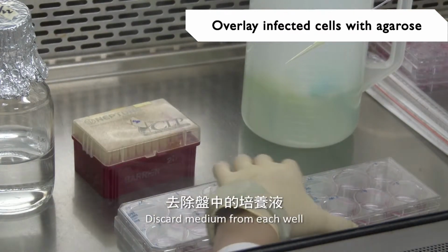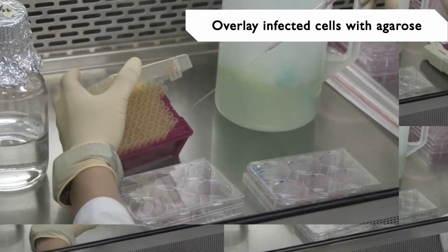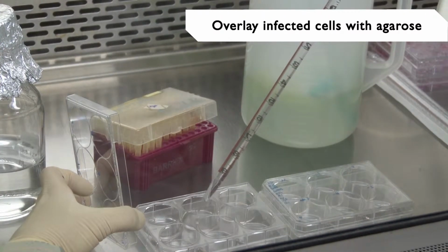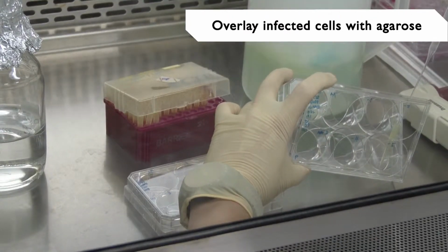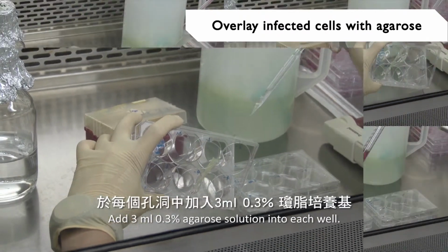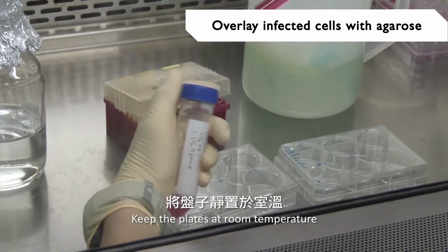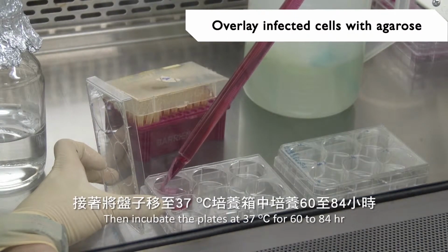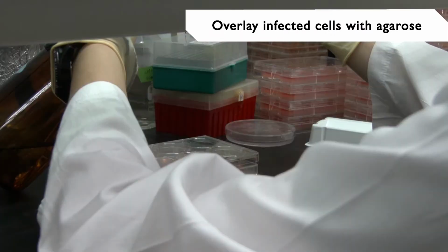Discard medium from each well and wash cells with 500 microliter PBS. Add 3 ml 0.3% agarose solution into each well. Keep the plates at room temperature until the agarose overlay solidifies. Then incubate the plates at 37 degrees Celsius for 60 to 84 hours.